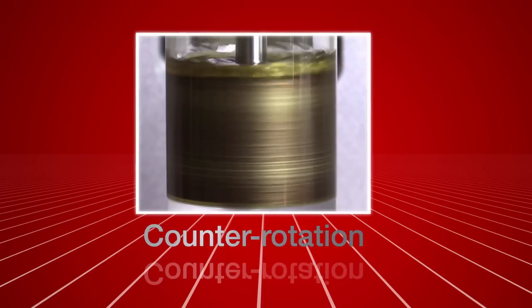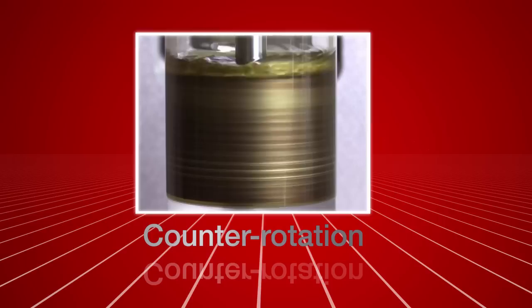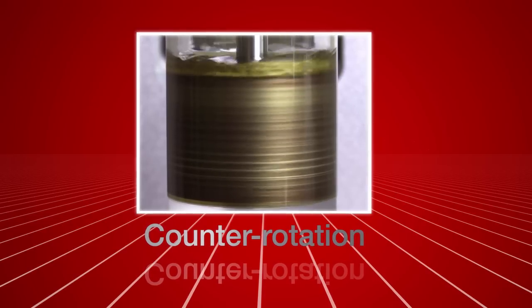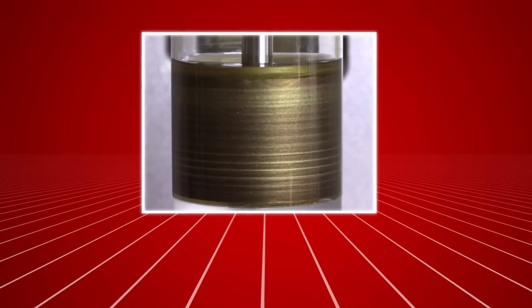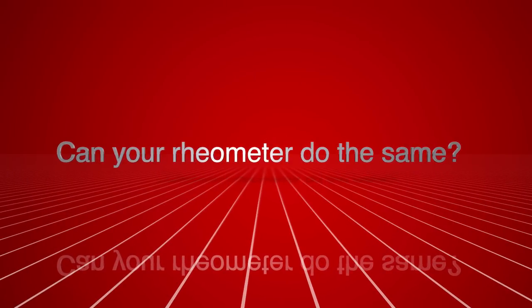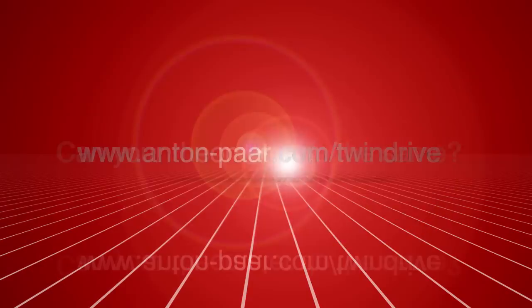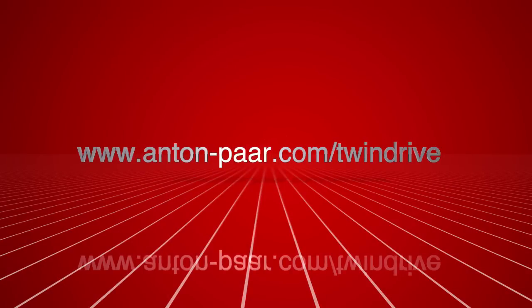This is one of many new TwinDrive possibilities. Can your rheometer do the same? Find out more at anton-paar.com/twindrive.